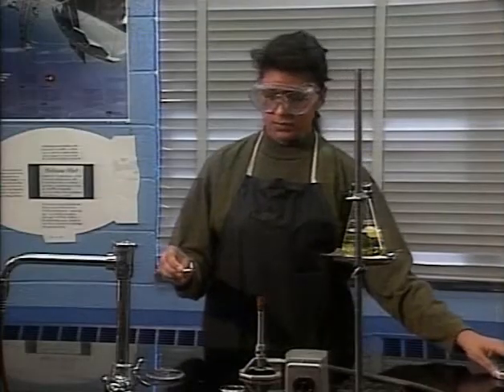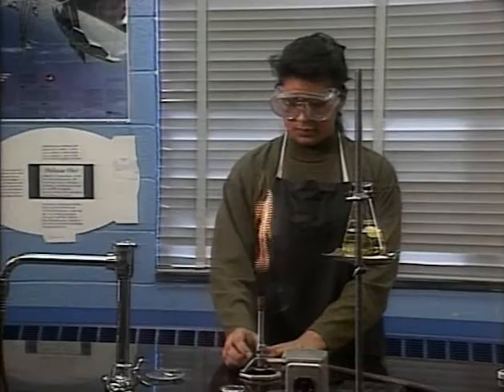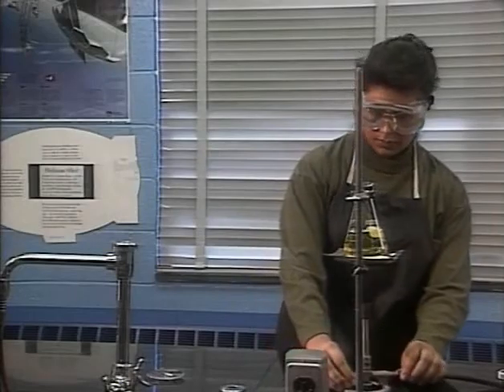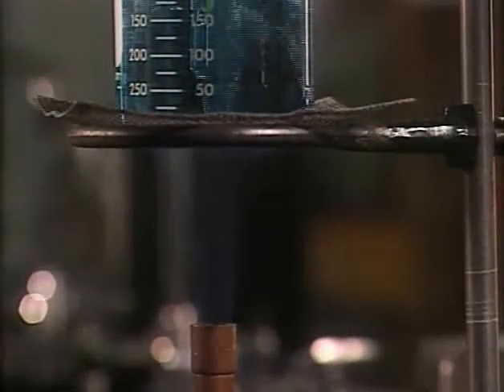When using a match, strike it away from you and turn the gas on after the match is burning — that way gas won't escape while you're striking. Light the gas from the side so the match isn't blown out. A yellow flame is too cool; opening the air holes lets in more oxygen for combustion. Adjust the bottom valve if the flame is too large or small. The flame should be blue with a lighter inner cone — the tip of the inner cone is the hottest part.